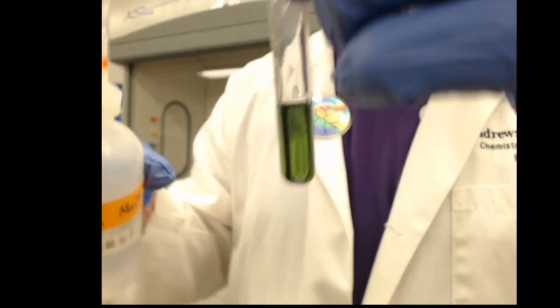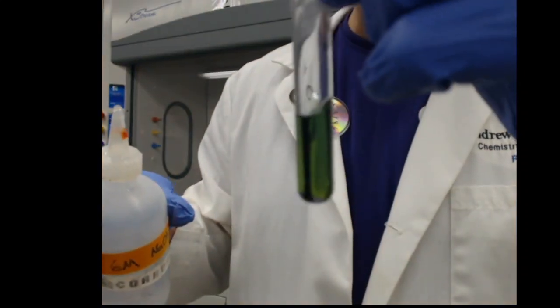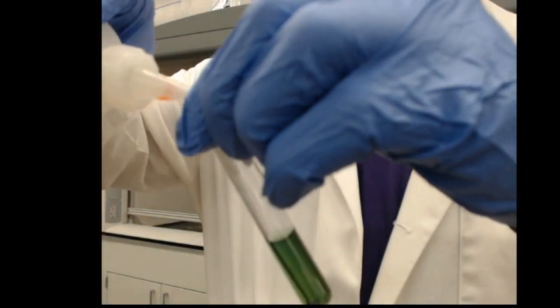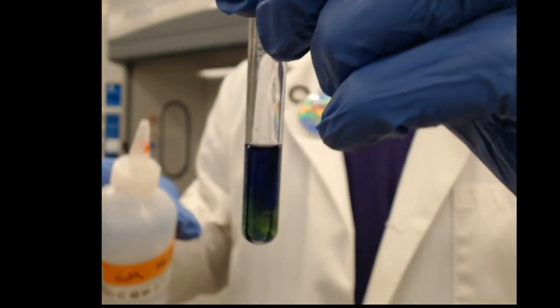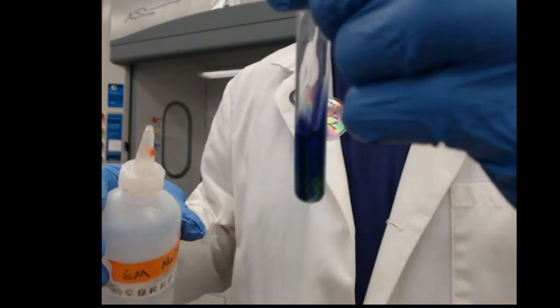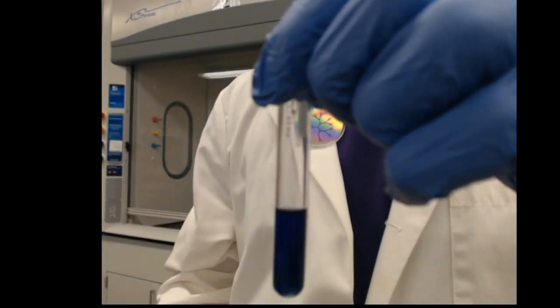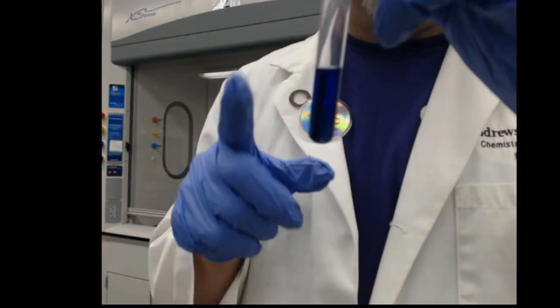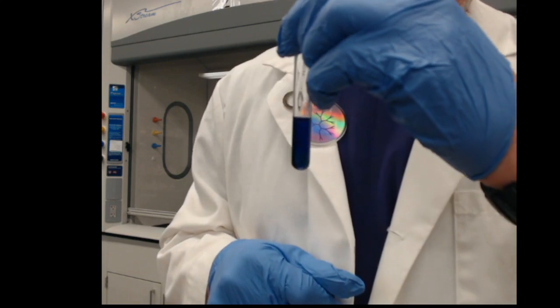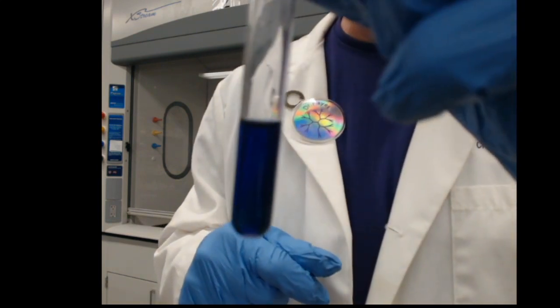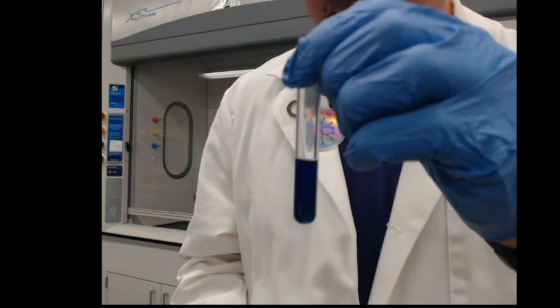A few more drops, drop by drop. Oh, I'm seeing some other colors show up. Oh, wow, look at that. And now it has flipped to the other form of methyl violet, back to the violet color. Oh, it's very dark in there.